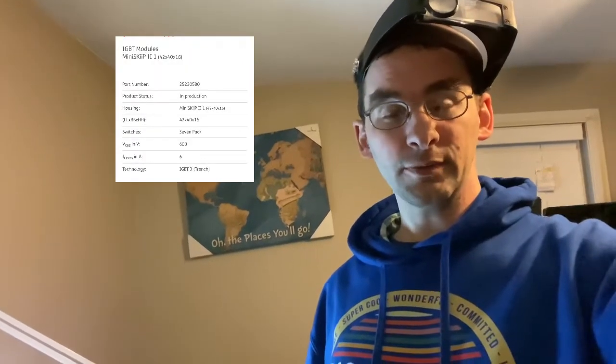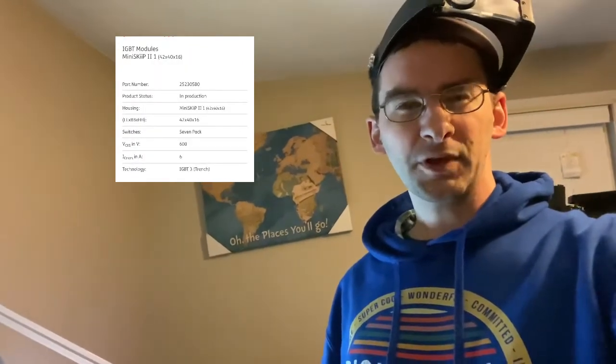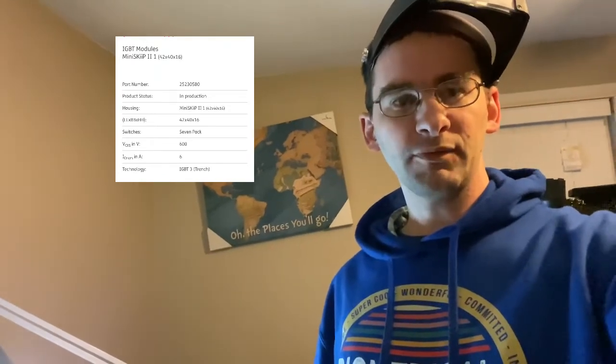This centrifuge, when it has this error 36, is a very simple fix. You have to buy the SKiiP part, S-K-I-I-P, I believe is how it's spelled. It's like 45 bucks or whatever online, if you can find it. The company wanted $2,400, almost $2,500, to fix it.